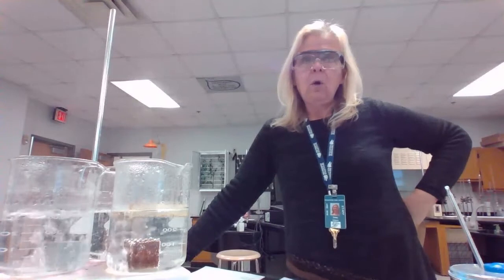The other thing you need to know is that the water in the calorimeter is a total of 100 milliliters in each calorimeter. So when we are calculating Q, we are going to use the mass of the water, not the masses of the metals. The masses of the metals will be used later when we want to calculate moles of metal that we put in there. But for right now, we're just going to focus on Q. So our mass of water will be 100 grams, because 100 milliliters is the same as 100 grams of water.